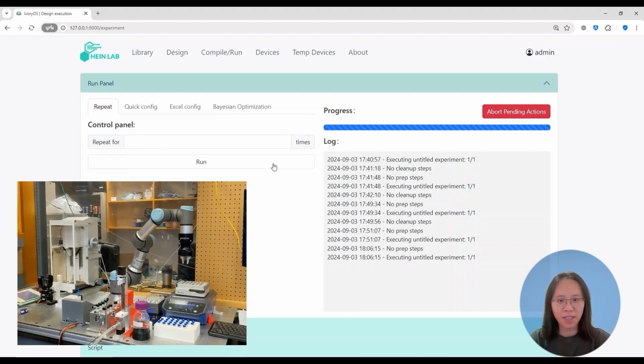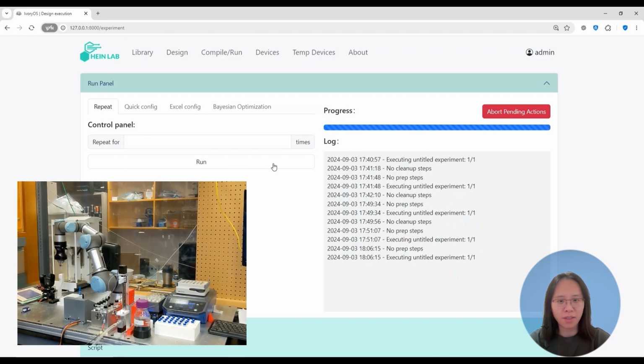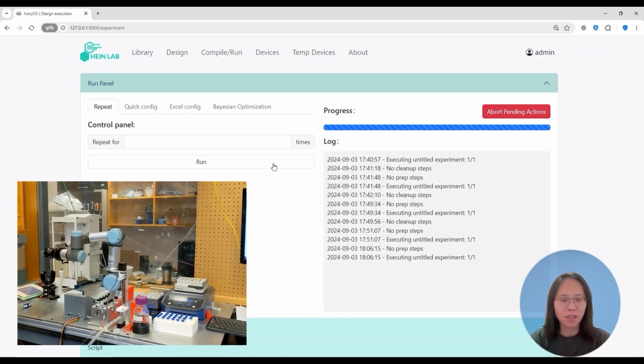So now you will see the robotic arm is trying to pick up the vial from the thermal shaker, and it will rotate 180 degrees all the way to the left-hand side of the deck and slowly put it onto a vial holder. This holder is specially designed to securely transfer the vial onto the balance. Now the arm is waiting for the Quantos to tare, and once it's done, it will rotate its forearm into its horizontal layout, so it will be able to transfer the vial holder into the balance.